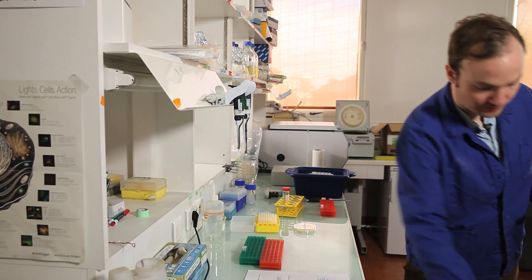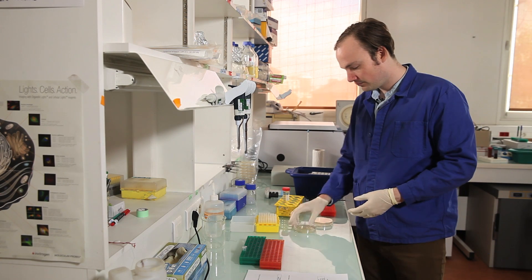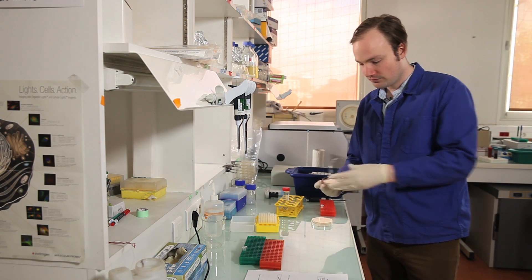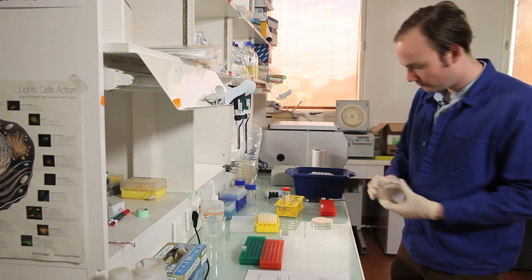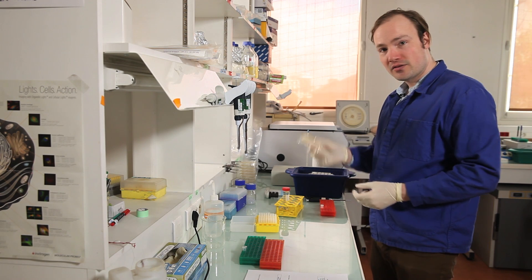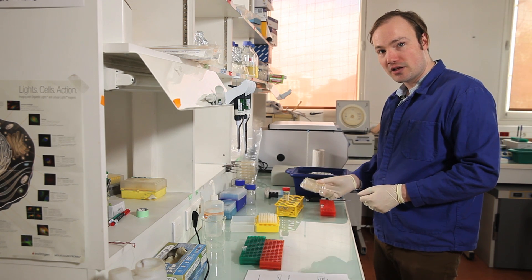And that's it. These are ready to go in the incubator overnight.